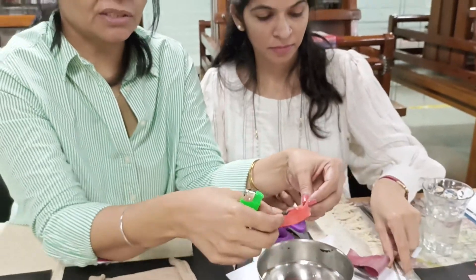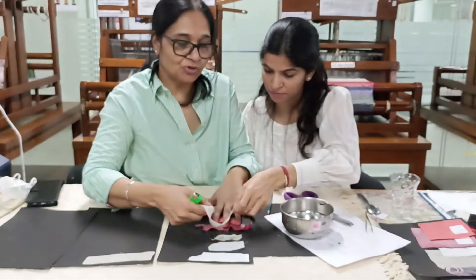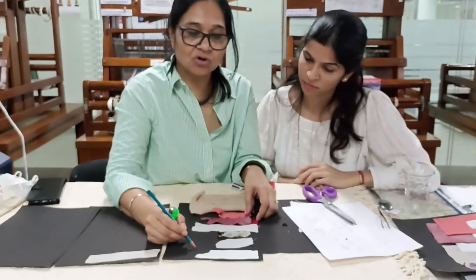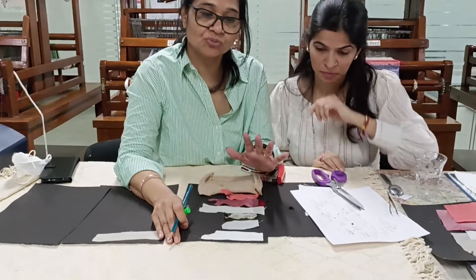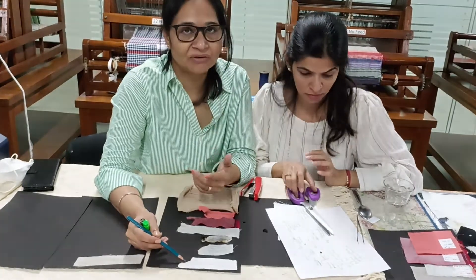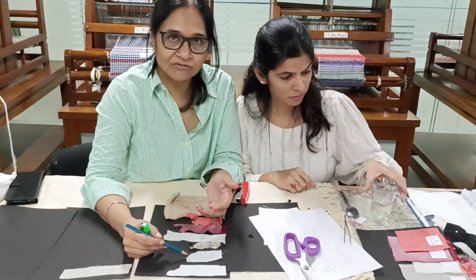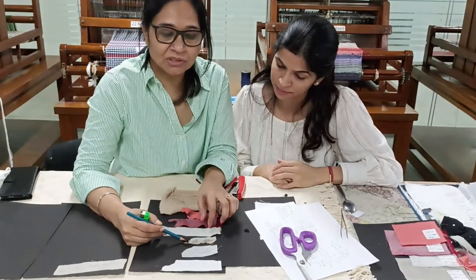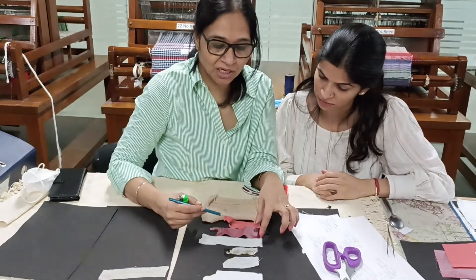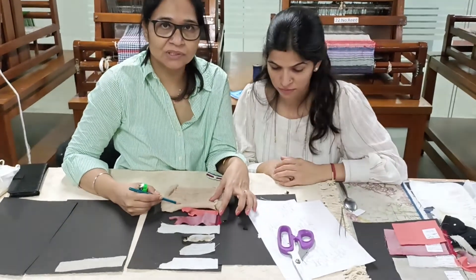Now, once you have done all these tests, put all the fabrics together and put your observations with pencil in sequence, following the classification table. Cotton catches fire very easily — it's highly flammable, burns like paper, leaves a feather-like ash, and has an afterglow. Linen burns exactly like cotton — highly flammable. Rayon is also highly flammable because it is obtained from wood pulp. Wool is self-extinguishing. Silk is also self-extinguishing. Polyester is highly flammable, forms a molten substance, and carries flame. Acrylic is a substitute for wool and burns like polyester.